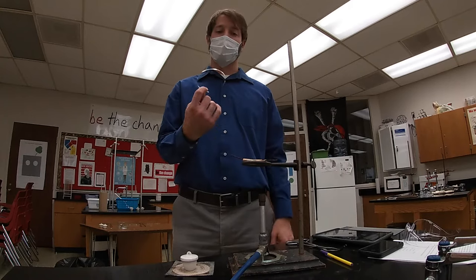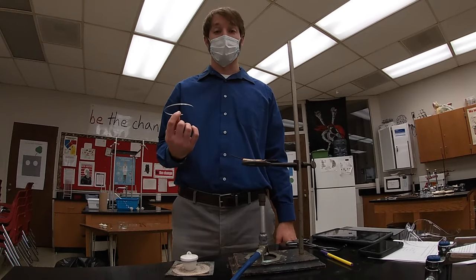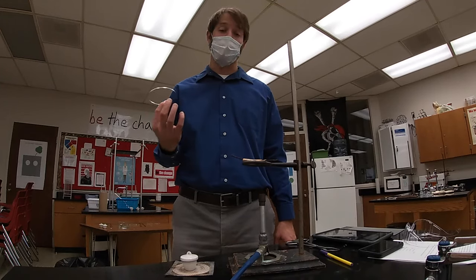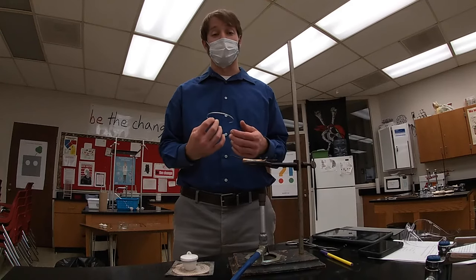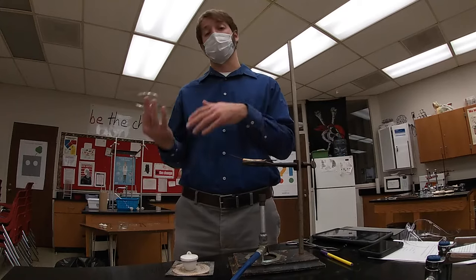The purpose of this lab is to take magnesium metal and heat it in the presence of oxygen. By doing that, you create magnesium oxide. If you have and keep track of the mass throughout the experiment, you can then determine the percent composition of magnesium oxide — the percent magnesium and the percent oxygen.